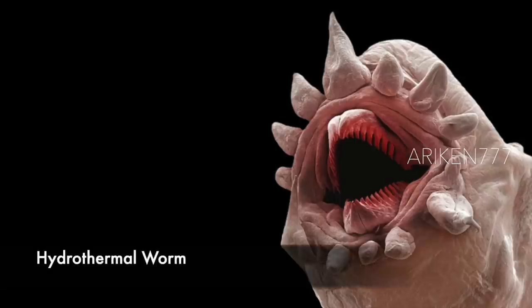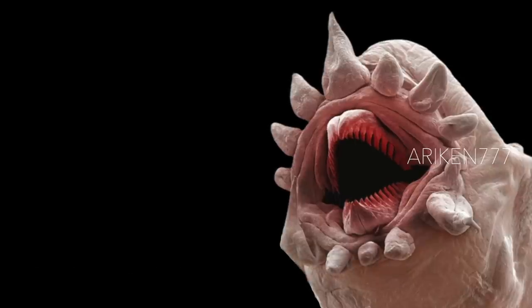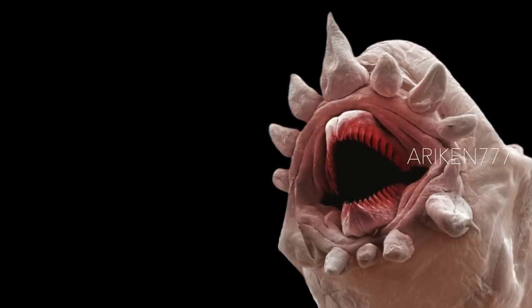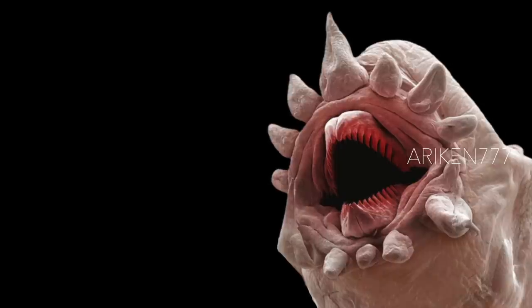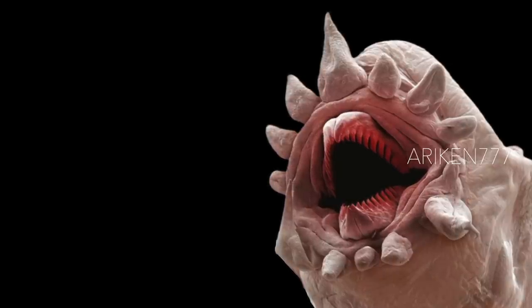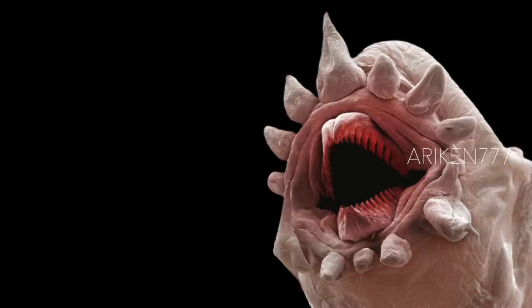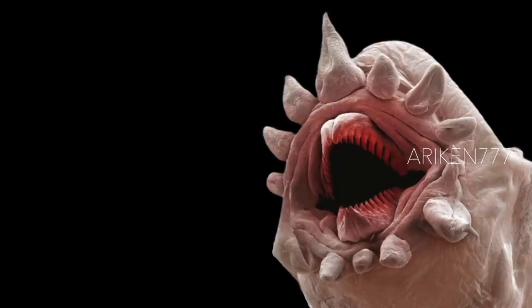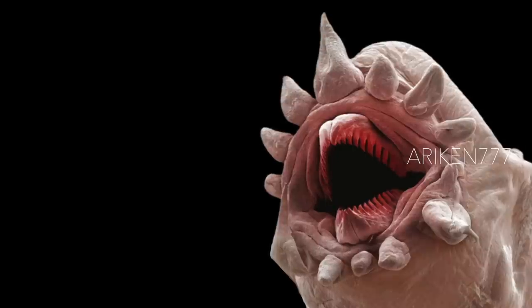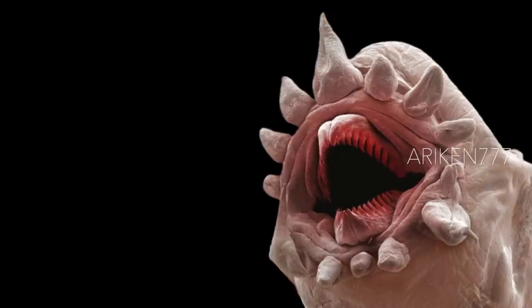A deep ocean scale worm. This species of worm lives on the edges of hydrothermal vents 2,500 to 3,000 meters below the surface of the Pacific Ocean. They feed on bacteria that live directly off minerals released by the vents. The worms also host a population of symbiotic bacteria that may supply the worm with additional nutrients. Hydrothermal vents are found along geologically active zones deep underwater, releasing superheated water and dense mineral deposits, forming huge towers that support a wide variety of fauna.